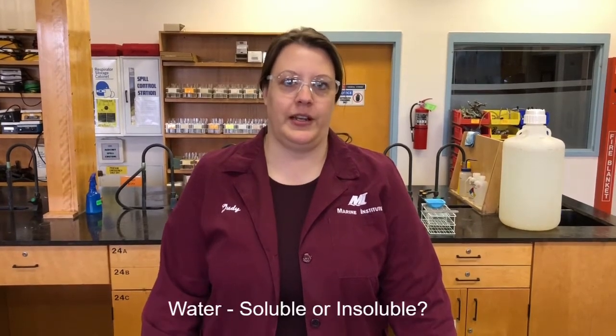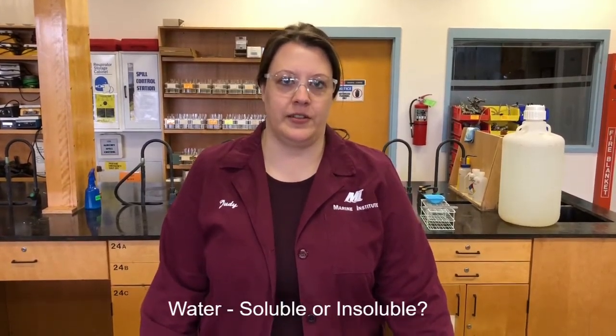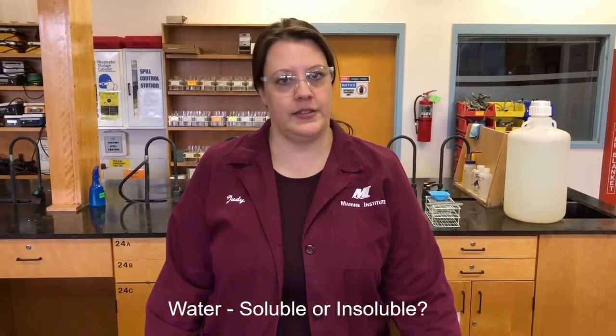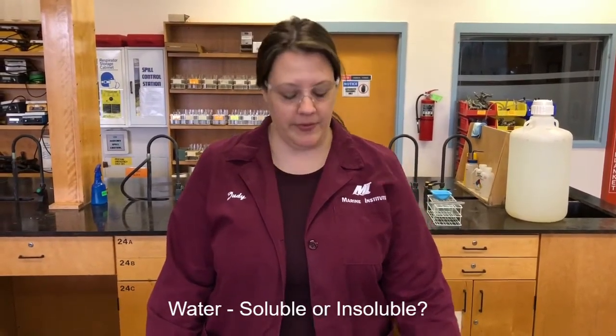The next property we're going to look at is the effect of adding water, and what we're really looking at here is just if it's soluble or insoluble. So if it dissolves in the water, that tells us that it's soluble. If it doesn't dissolve, then it's insoluble. Okay, so we're really just looking at two things, soluble or insoluble.